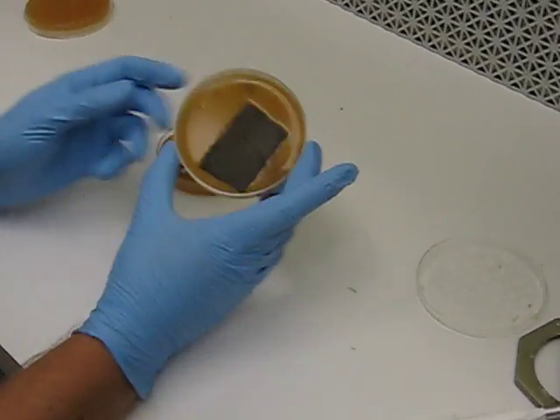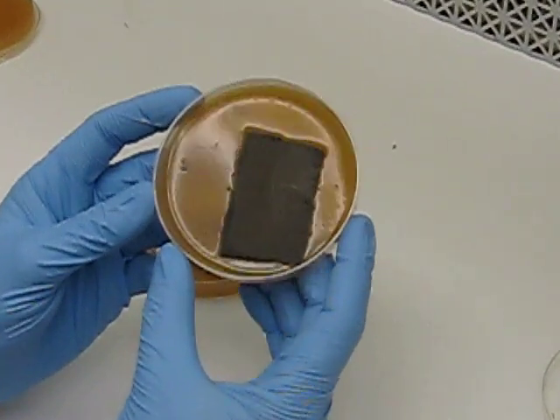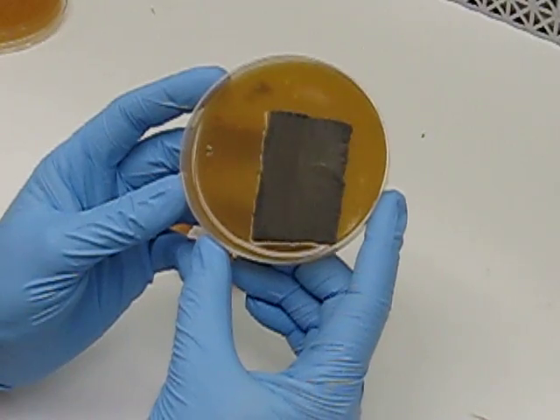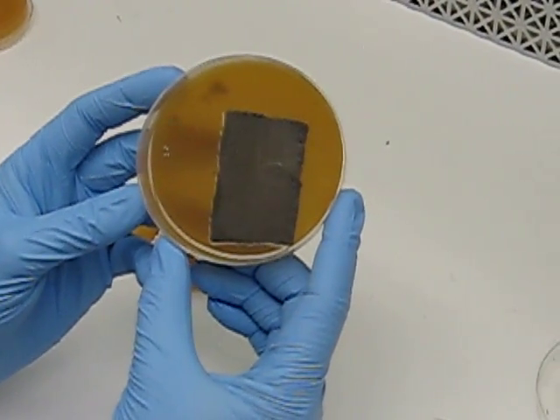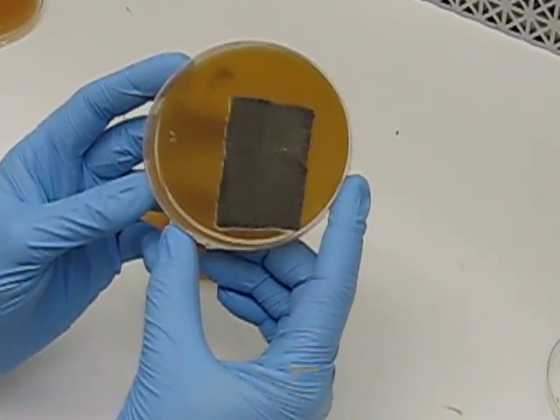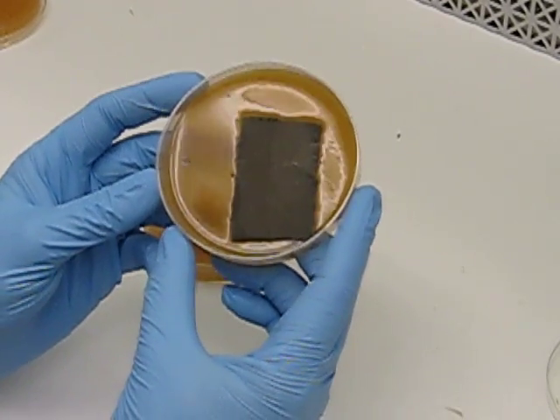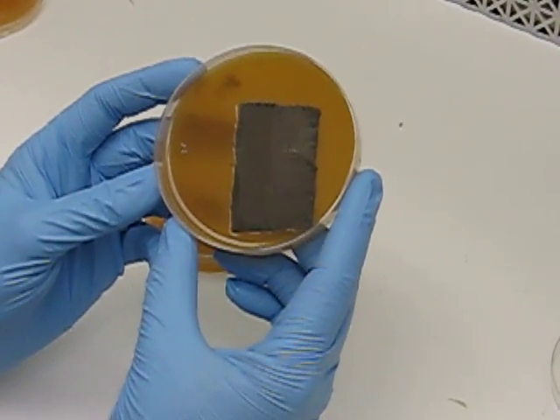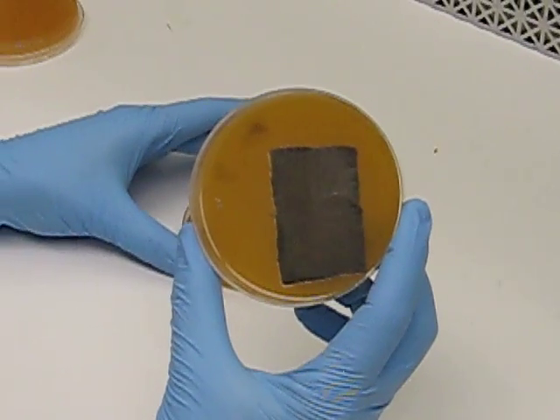Let's take a look at the plates very quickly. This is a Cercospora plate that's been grown on V8 media in the dark for four days. You'll notice it's very uniform in color, and that color is a light gray. The gray means that it's sporulating, and those are the type of tissues we want to continue through the subculturing process.